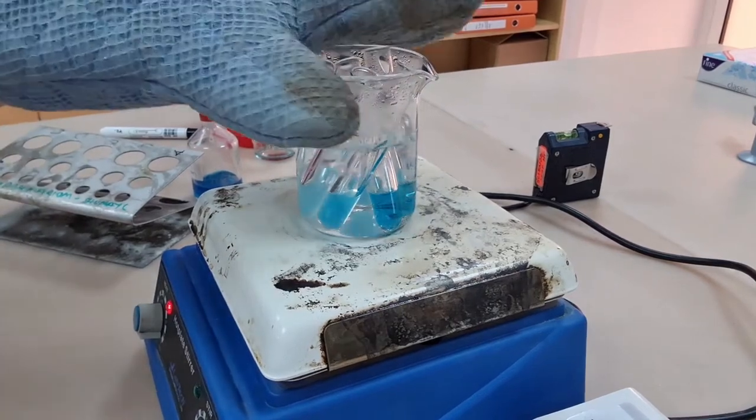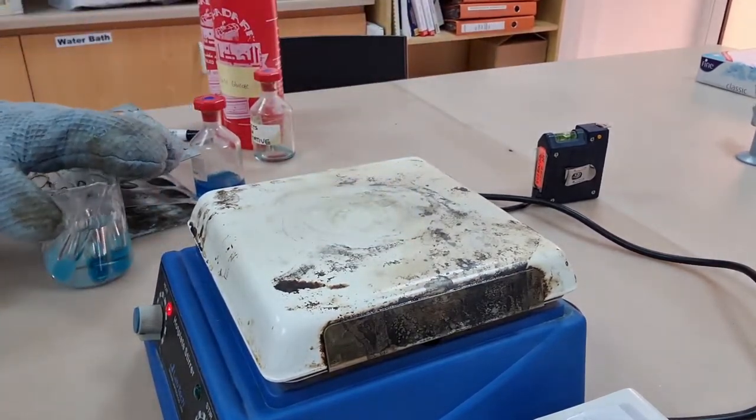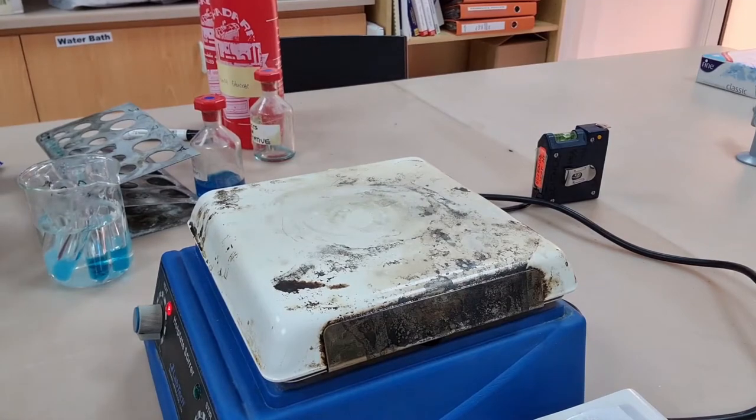As you can see some of the tubes have just become a little bit opaque. They haven't turned green, yellow, brown or brick red.